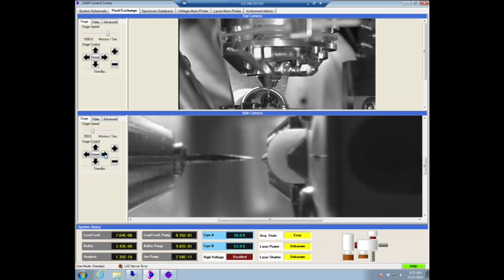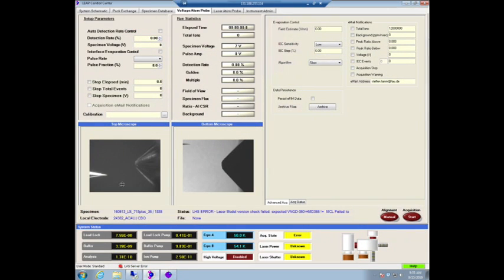And you need to go just far enough so that in the microscope, so these are actually TV cameras that are in there. And when you're doing the fine adjustment, there are some microscopes with actual microscope optics. So it's two different types of camera sets really, so you can't really seamlessly move from one to the other. It also means that they have different angles towards the specimen, but that's not actually that important for you to be able to see the sample. So now you can see the sample. It's nice and sharp and it's shiny.